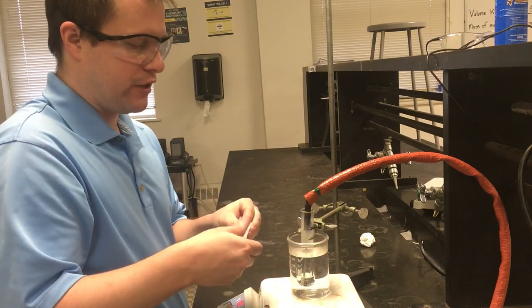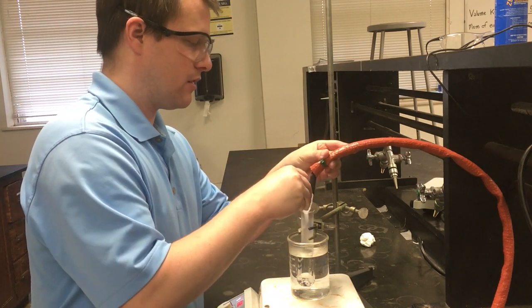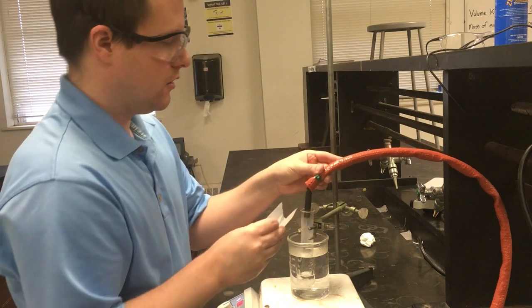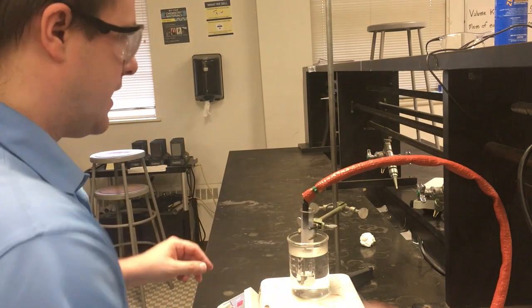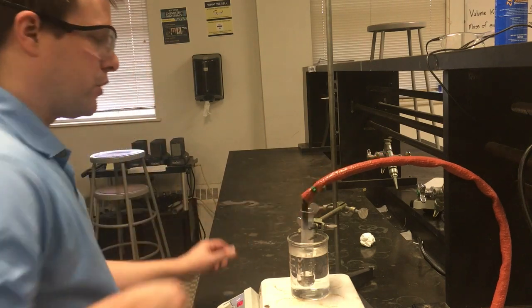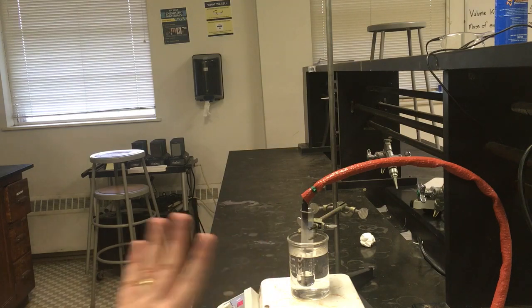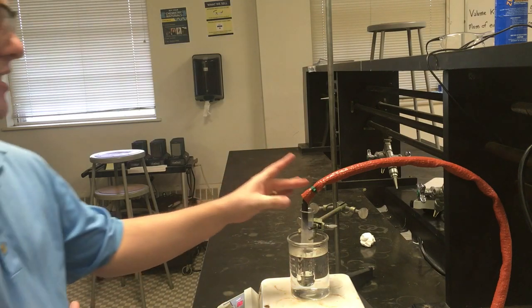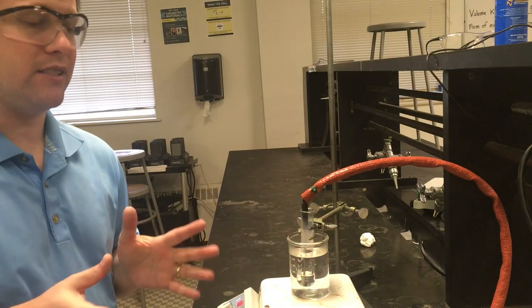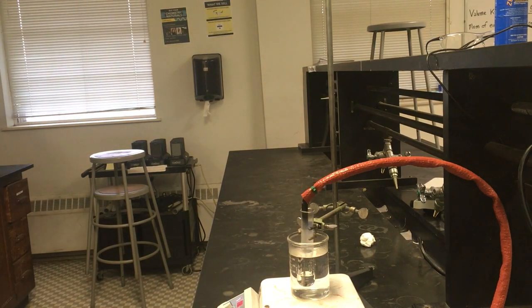And I'm just going to very carefully add this to our naphthalene that I've now remelted down in our test tube. Make sure I get it all in there. And I'm going to give this all a minute to kind of coalesce and melt down in there. Notice this is the exact same setup I had in part 1, which means the test tube mass, the naphthalene mass, all of that is the exact same still.